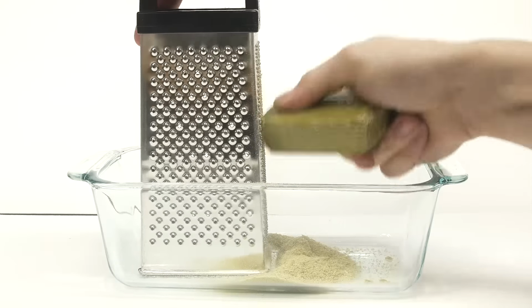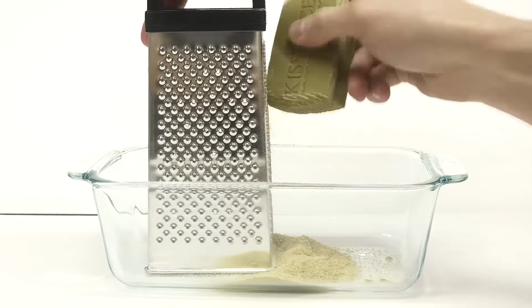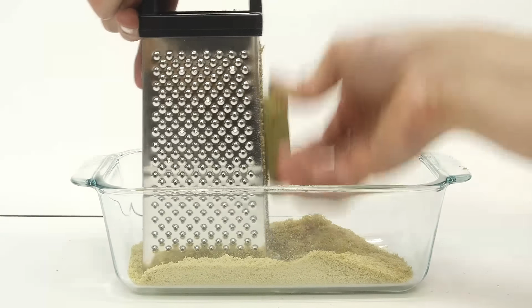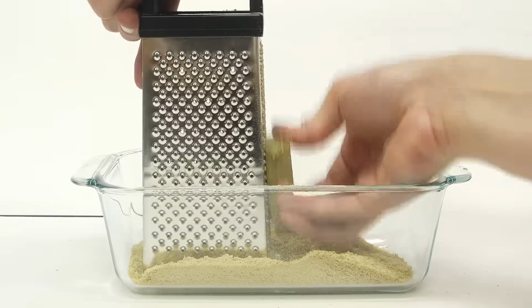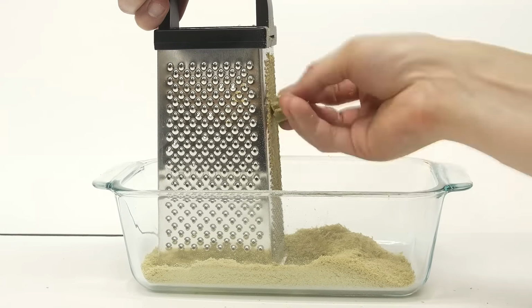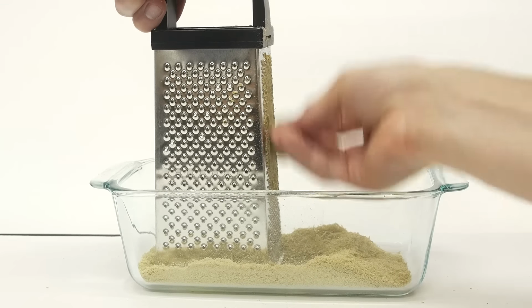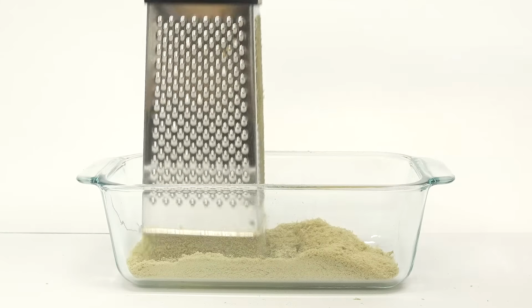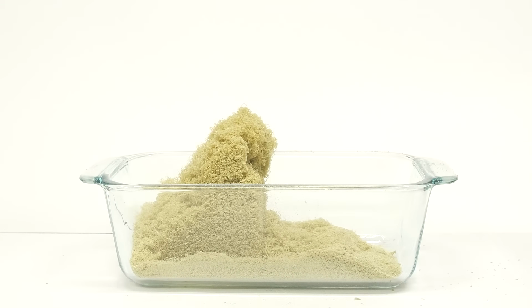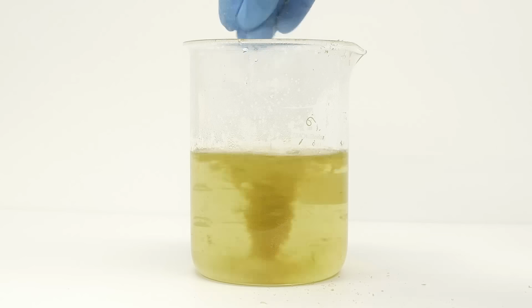Okay, to start things off, I need to grind up the soap. I decided to do it manually using a cheese grater, but there's probably an easier and more automated method. In the next step, I need to dissolve all of the soap into water, and powderizing it first makes it go way faster. It is possible to just chop the soap up into smaller pieces, but if you do this, be prepared for a long and painful dissolving process. After a lot of pain and effort, this is what I'm eventually left with. All the soap was then added to some distilled water.